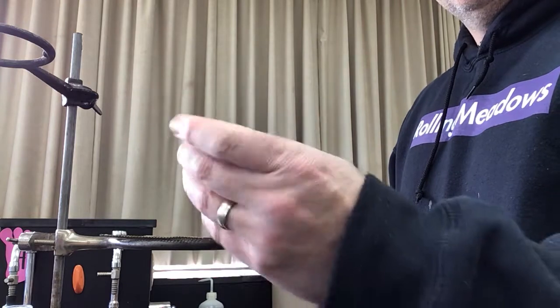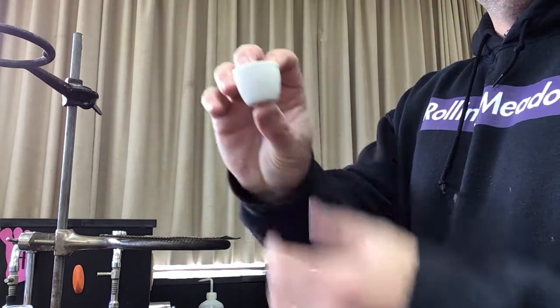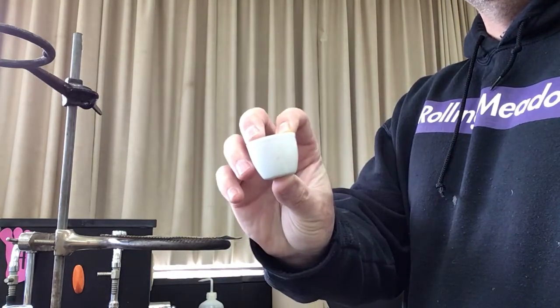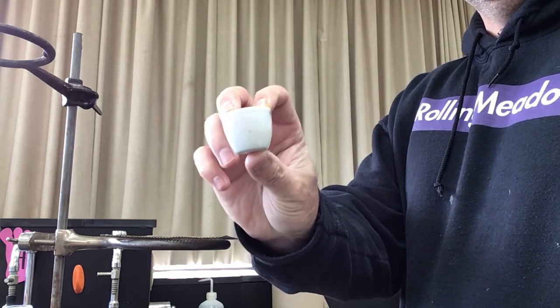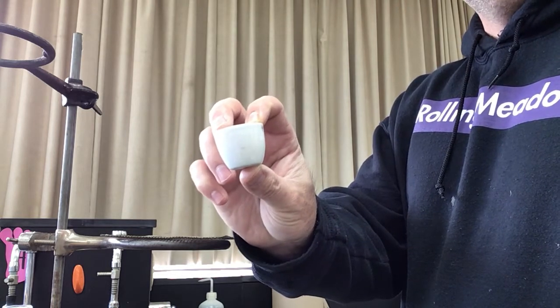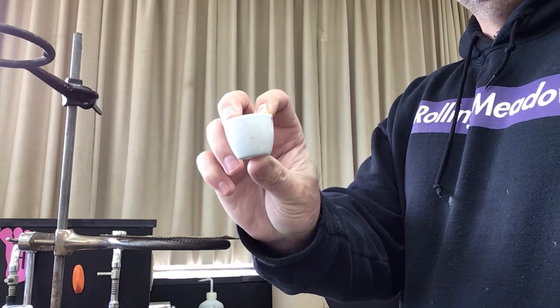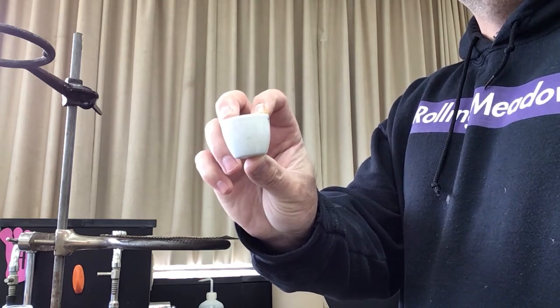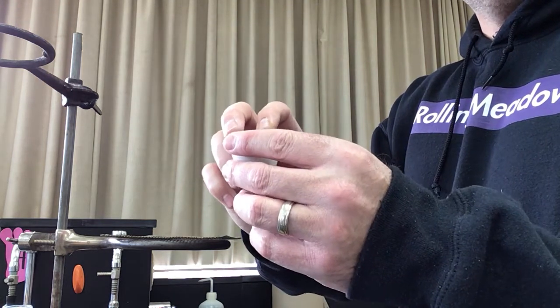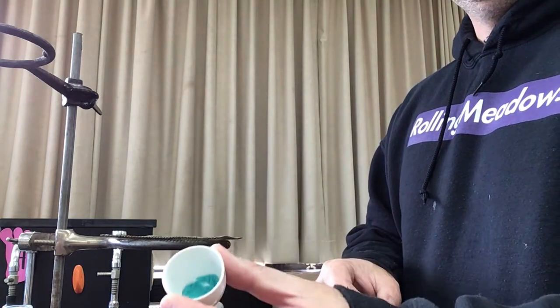I had a crucible, so this little cup is a little porcelain crucible, and what I did is I weighed this and it weighed 10.66 grams. Then our procedure said to measure out about a gram of our green copper chloride hydrate.